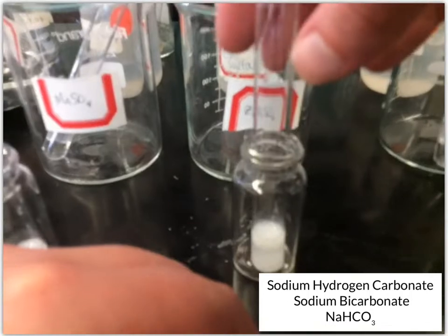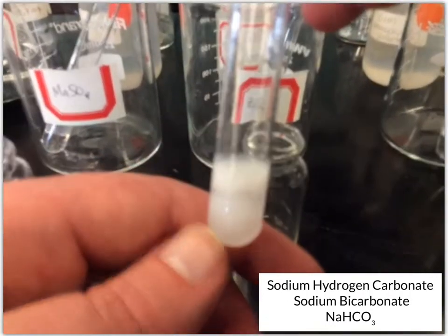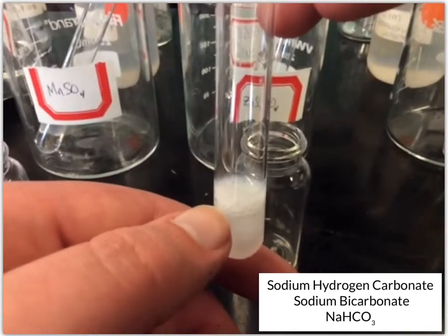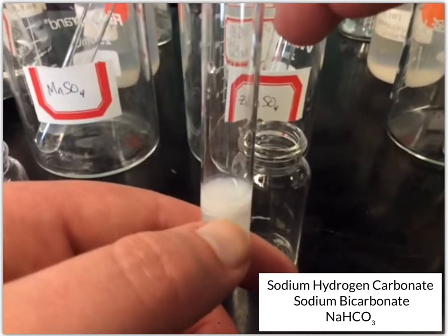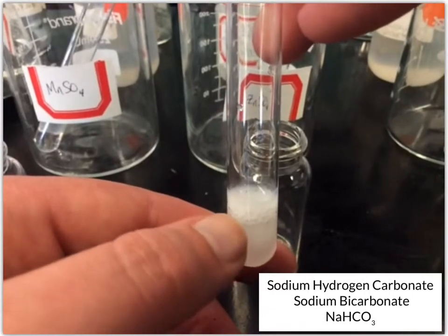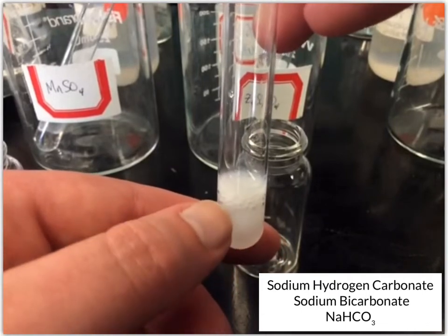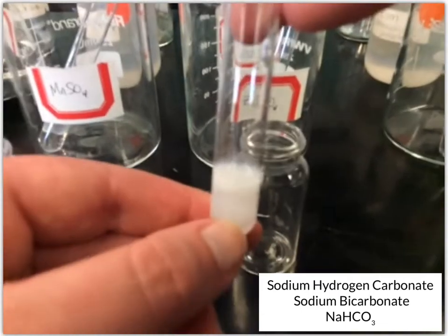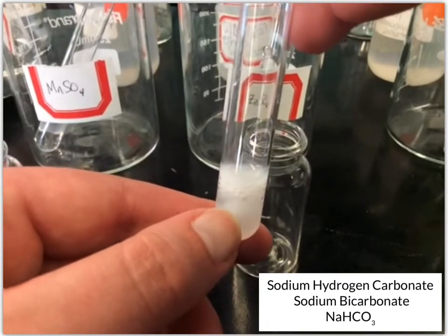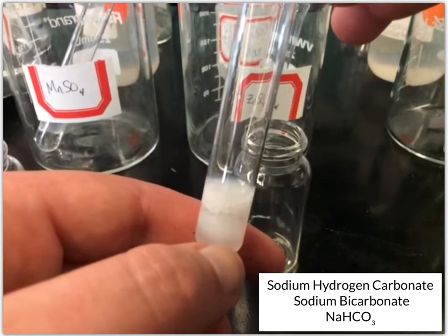Let's see, then we have our zinc sulfate. Now this one's kind of interesting. This one looks quite a bit different. You've got some odd bubbles that have formed in there. And it's actually, right now, bubbling. And so not only did we form some white solid, but we also have bubbles being formed at the same time. And so those are being slowly formed, and then every once in a while you see one pop. Yeah, you can see the bubbles coming up from the solution.